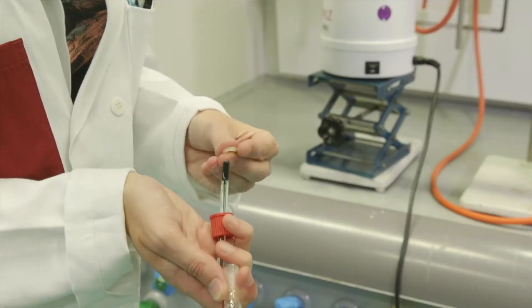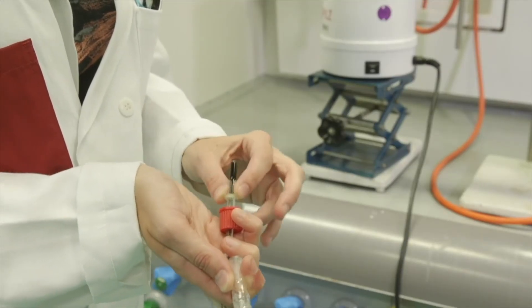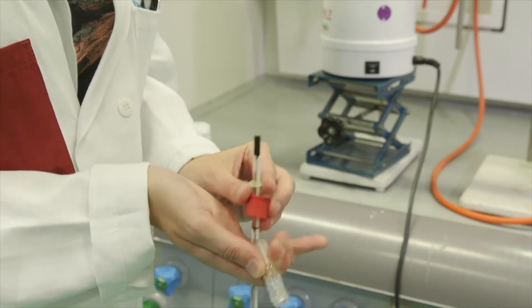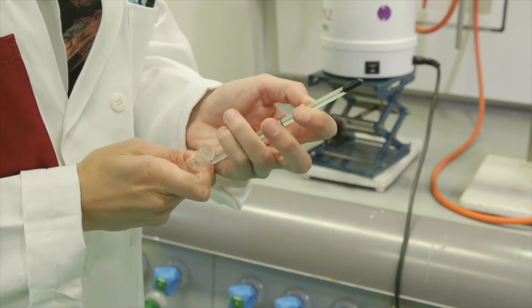Place the thermometer into the glass head. First, unscrew the cap and slide it, with the rubber ring, onto the thermometer. Screw the cap back on.